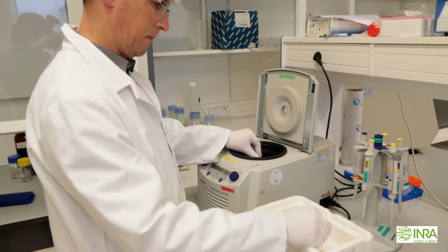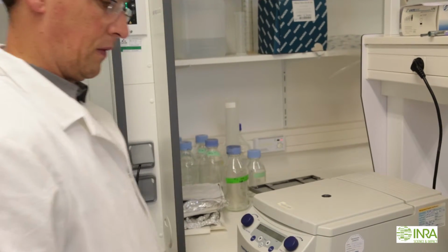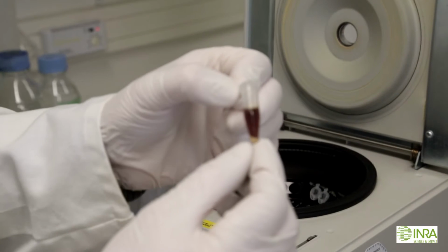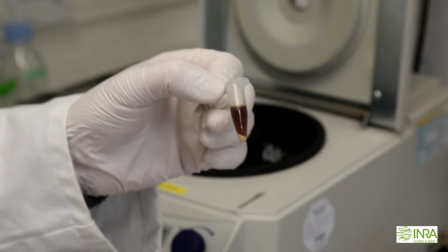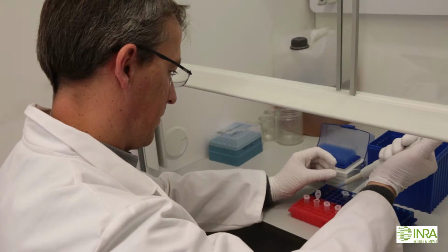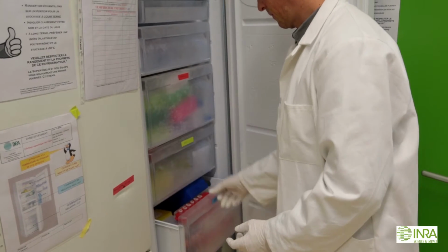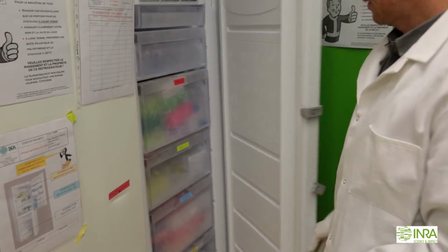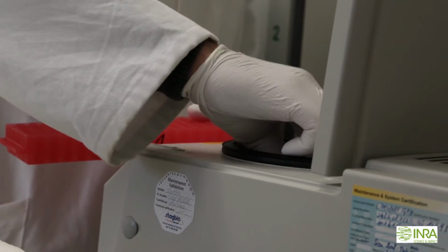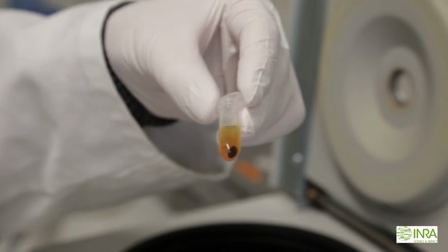The fifth step of the soil DNA extraction consists in nucleic acid precipitation and washing from the crude extracts of soil. After the protein precipitation, samples are centrifuged in order to remove proteins. The supernatant is collected and added with 1 volume of isopropanol. These samples are placed at -20 for 15 minutes in order to get the nucleic acids precipitated. After 15 minutes, they are centrifuged again in order to pellet the soil DNA.